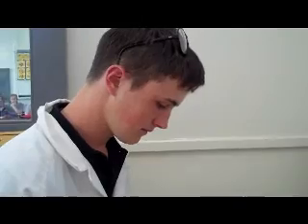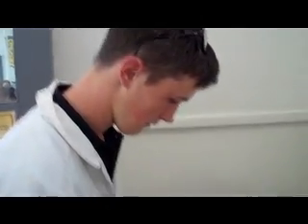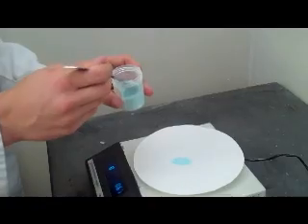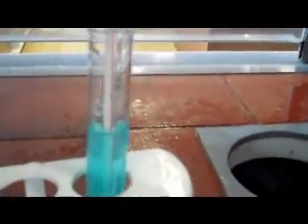Okay, Chris, our next reaction is mixing 10 ml of water with 1.5 grams of anhydrous copper sulfate. So you're measuring out the copper sulfate. Yep. And we're going to add that to the water. Okay, we've mixed water and the copper sulfate, and the temperature has gone from 21 and it's slowly rising. We've got 24 degrees at the moment.